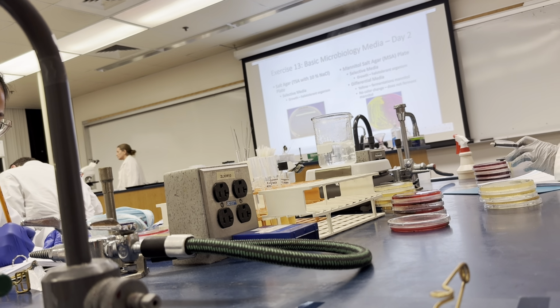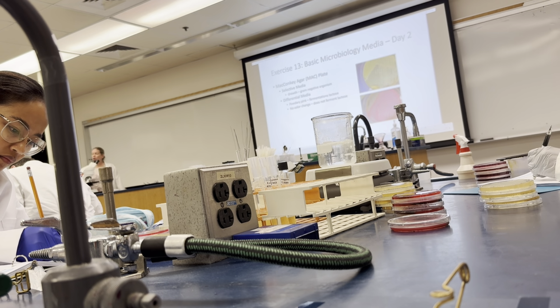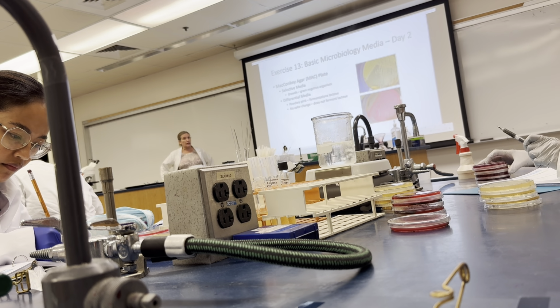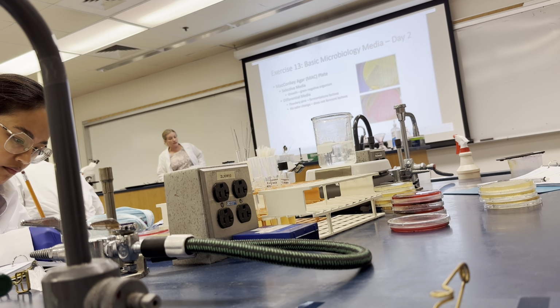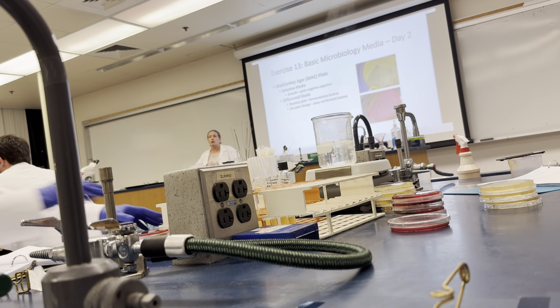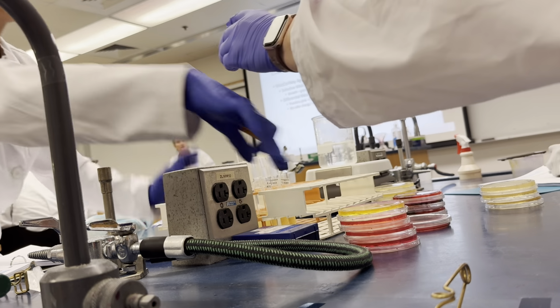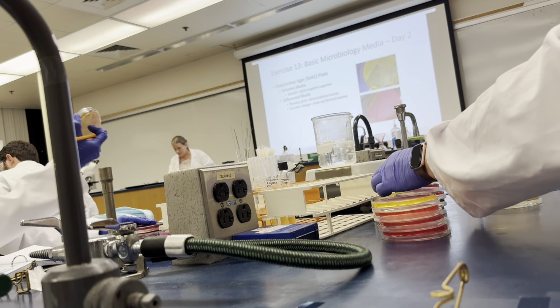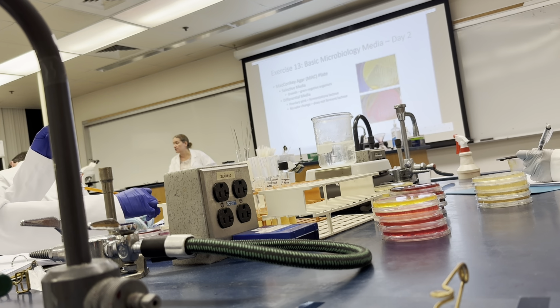Okay. All right. Now, the last set of plates is the MacConkey agar plate. So the MacConkey agar plate is selective, so it has two components, the selective aspect and the differential. The selective aspect is the fact that it has bile salts and crystal violet, and those inhibit gram-positive organisms. Thereby, you're selecting the gram-negative. Which organisms grew on these plates? Salmonella. Correct. Salmonella and E. coli, which both happen to be gram-negative organisms.